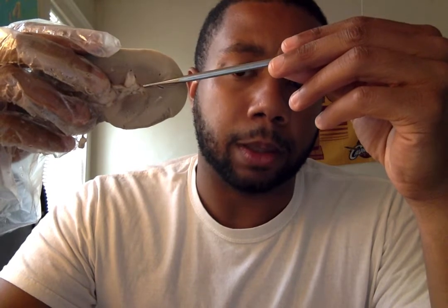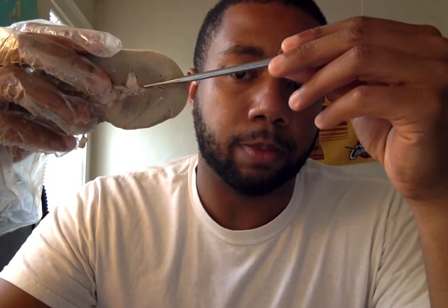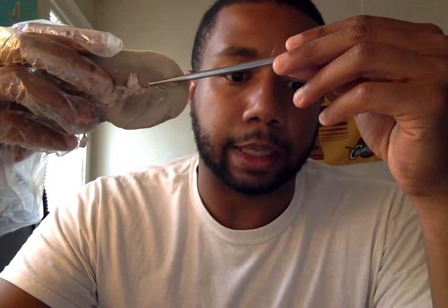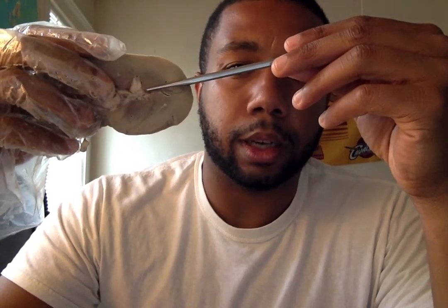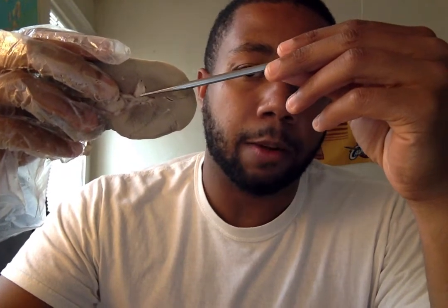And then at the bottom, at the renal papillae of these renal pyramids, the pointy end deep into the kidney, there are the renal sinuses, which are just empty spaces that are around the renal pyramids. So then, from the renal pyramids, this waste will drain into the minor calyces all around the kidney.